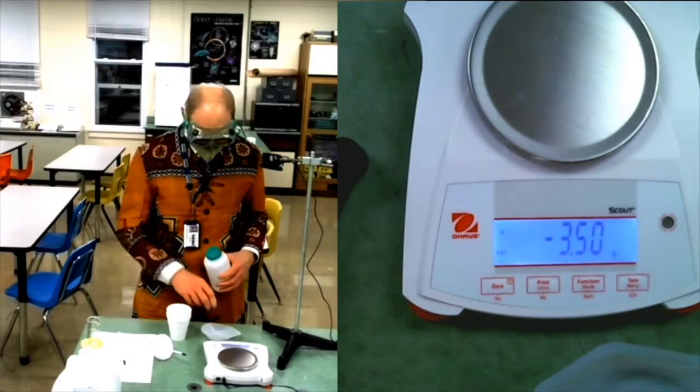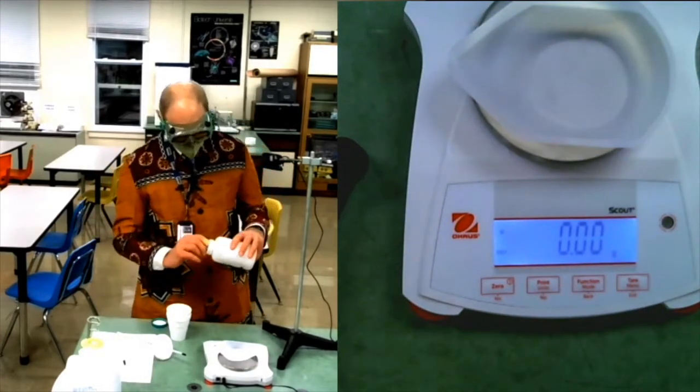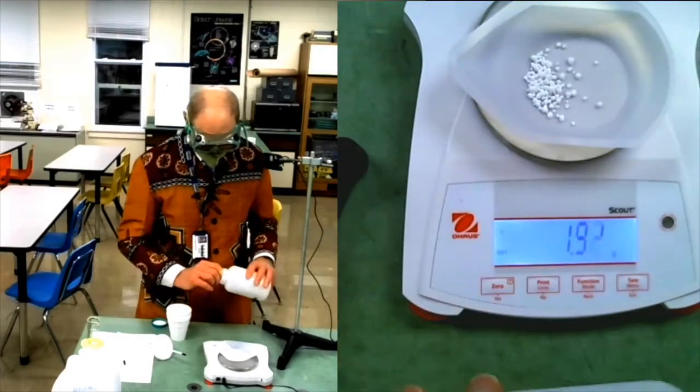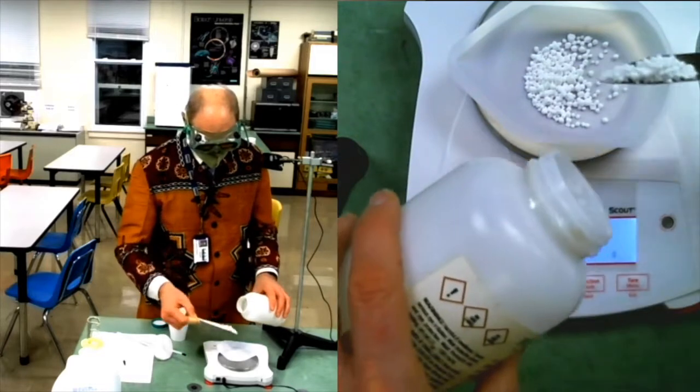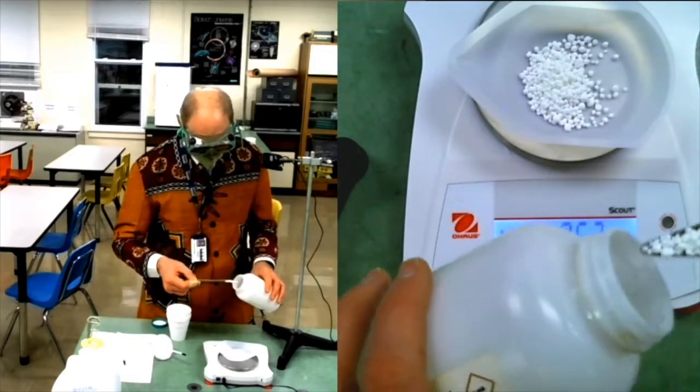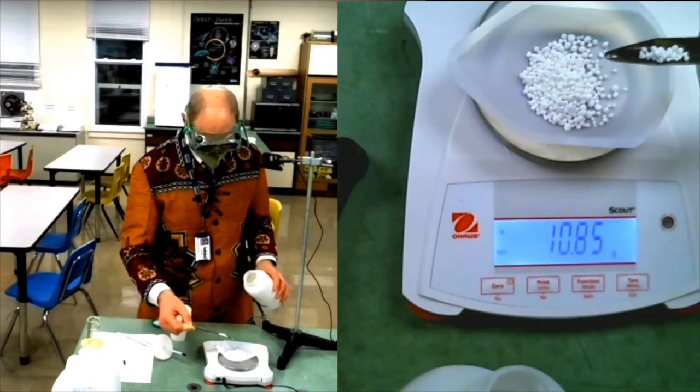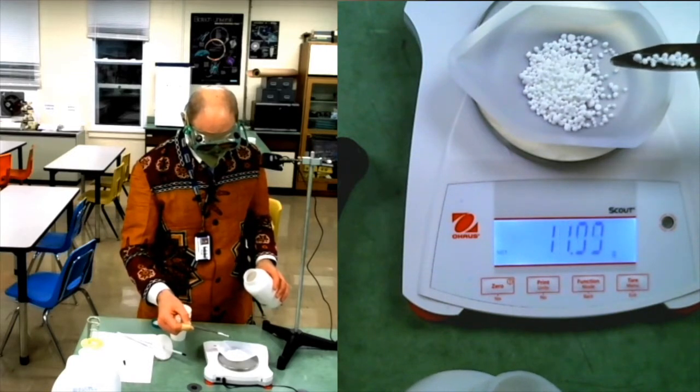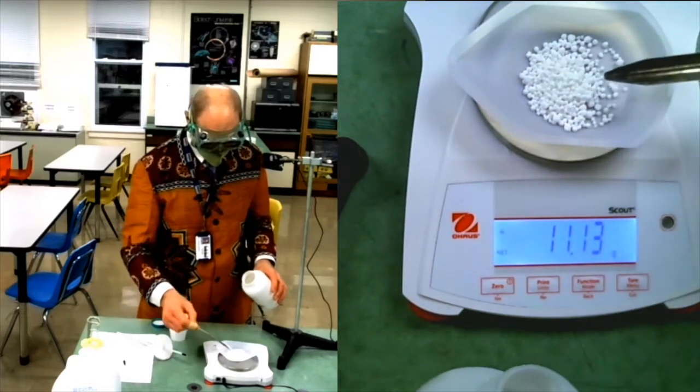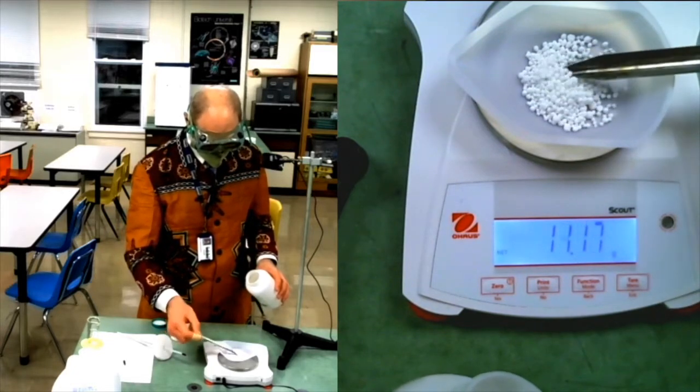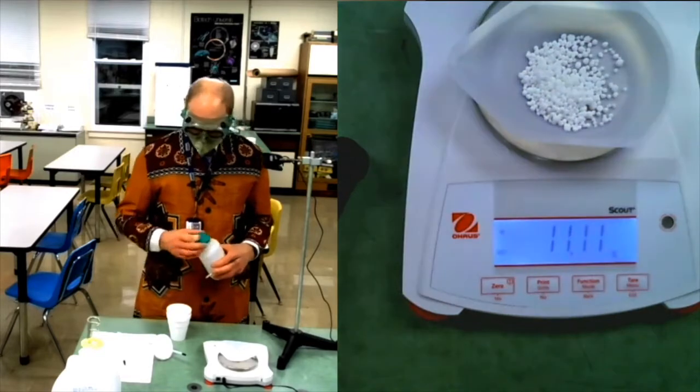Next, calcium chloride. So, 11.11 grams.